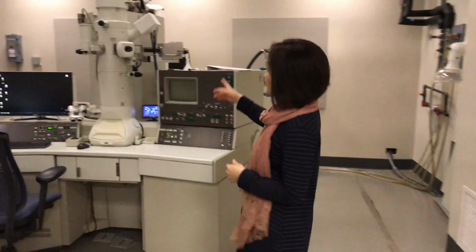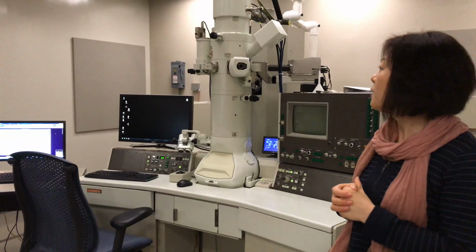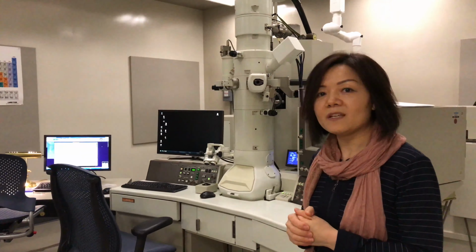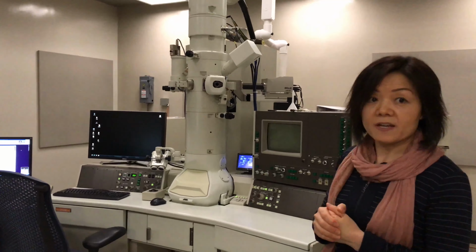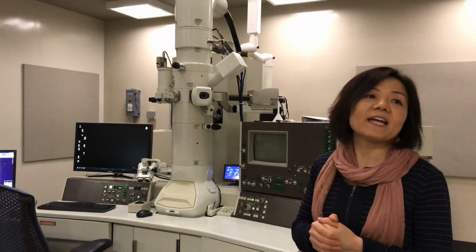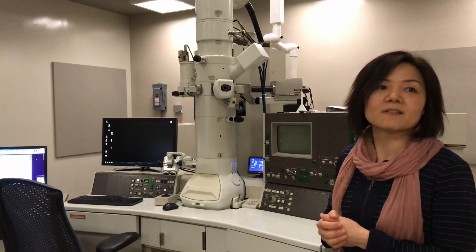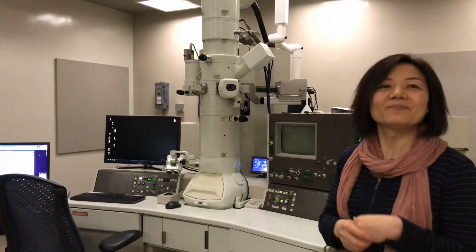This is a transmission electron microscope from JEOL. We have 2 TEMs here at SAFE, and this is 200 kV. We call it a high resolution TEM. Basically, we use it for mostly solid matter. The sample has to be very stable under electron beam. We do the lattice fringe imaging or particle size evaluation. When you have very small nanoparticles, several nanometers, you can use this one to check, and you can even see whether they are crystalline or amorphous. We can also do the EDS analysis on the material you are looking at.